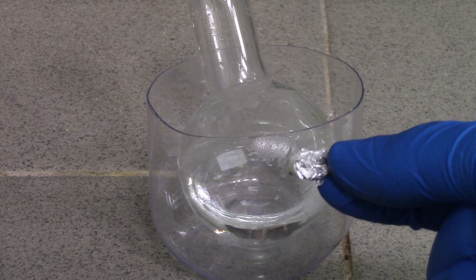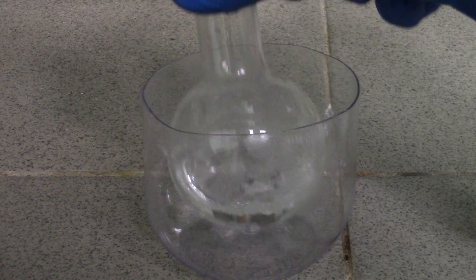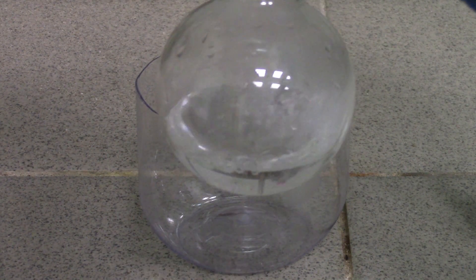Next, let's add a small piece of magnesium tape. And it's bubbling in a pretty vigorous way.